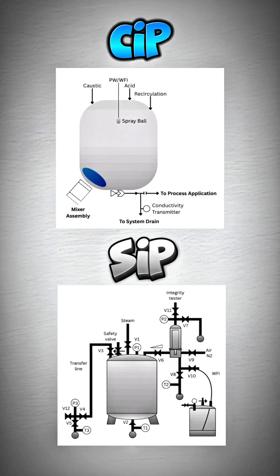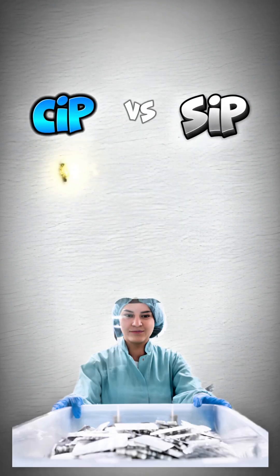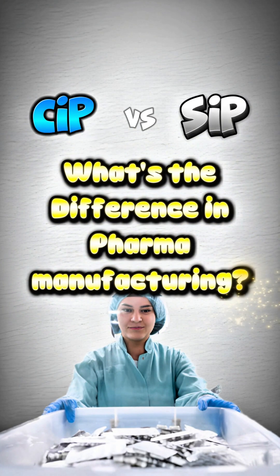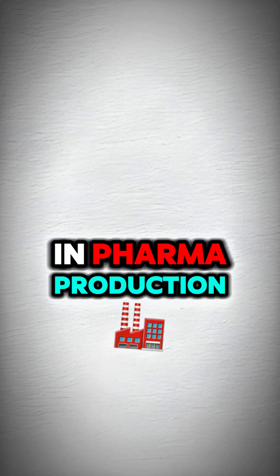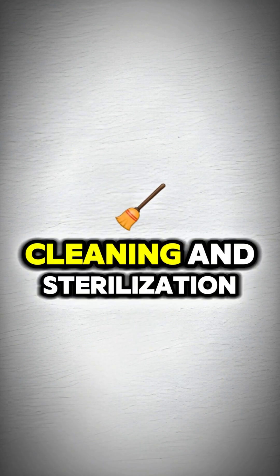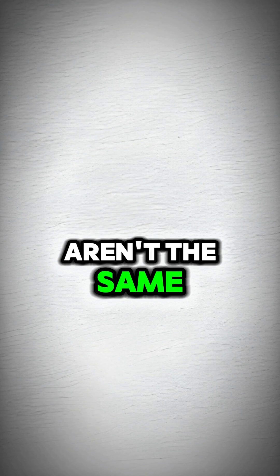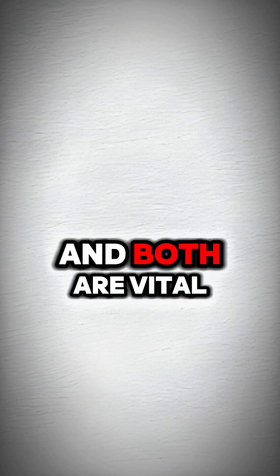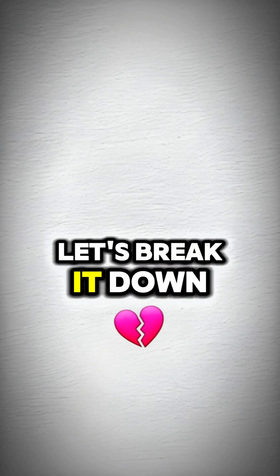CIP versus SIP — what's the difference in pharma manufacturing? In pharma production, cleaning and sterilization aren't the same, and both are vital. Let's break it down.